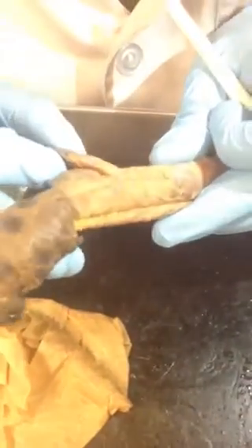Finally, this is the last home stretch, and I have to remember where I separated these muscles. The dorsal leg. Where did I put it? Sorry. These ones can be somewhat tricky. There it is.